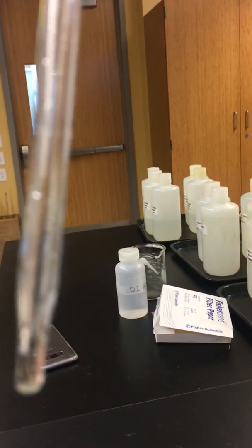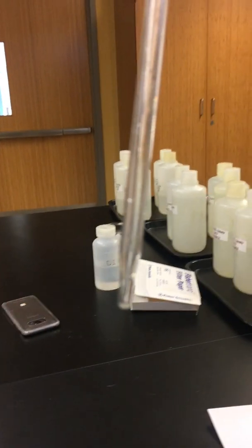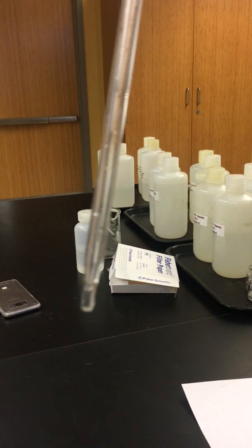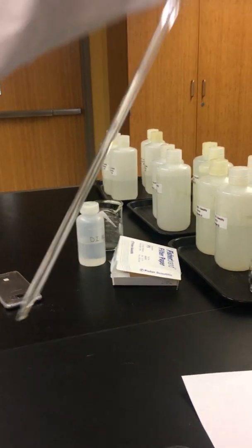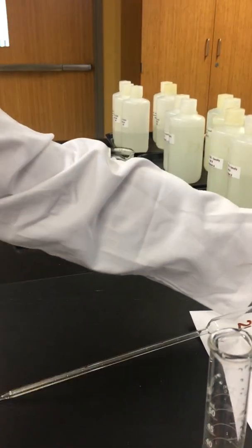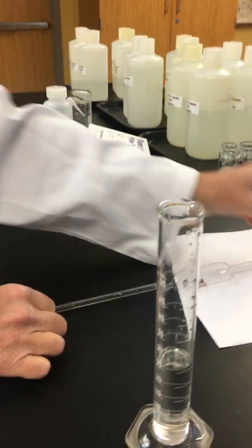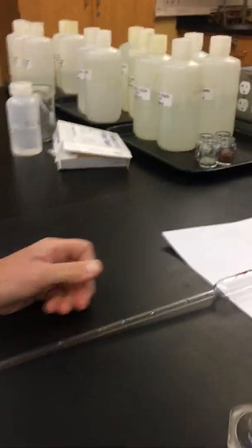And now notice at the base of this, there's one last drop in it. It's actually calibrated to keep that one last drop. We don't want to actually dispense that into our liquid. So now we're going to measure the volume in our graduated cylinder and compare the levels of precision to this.